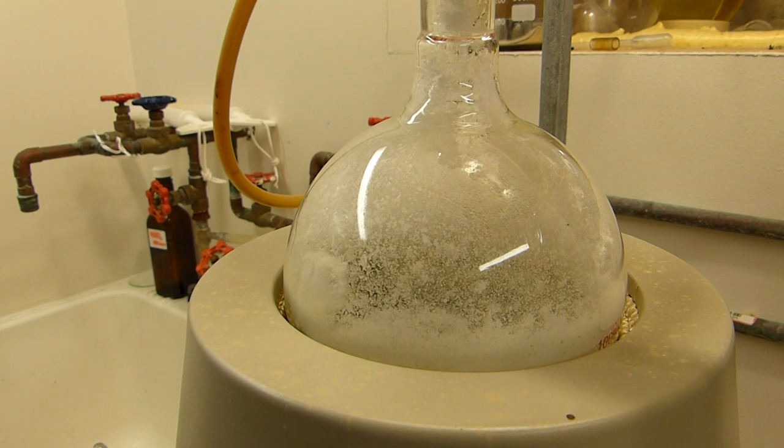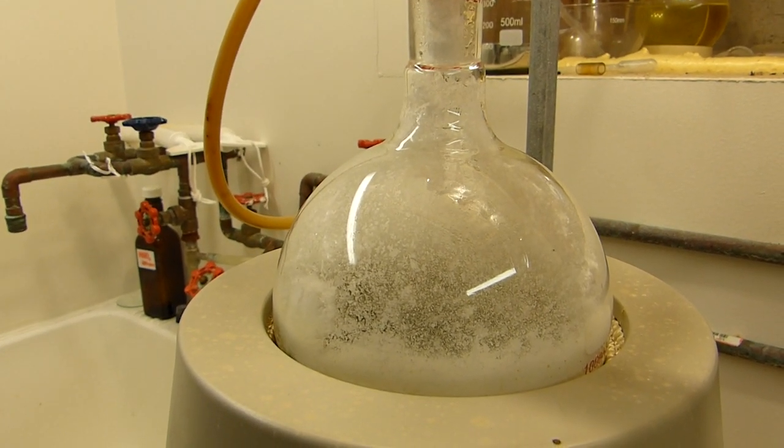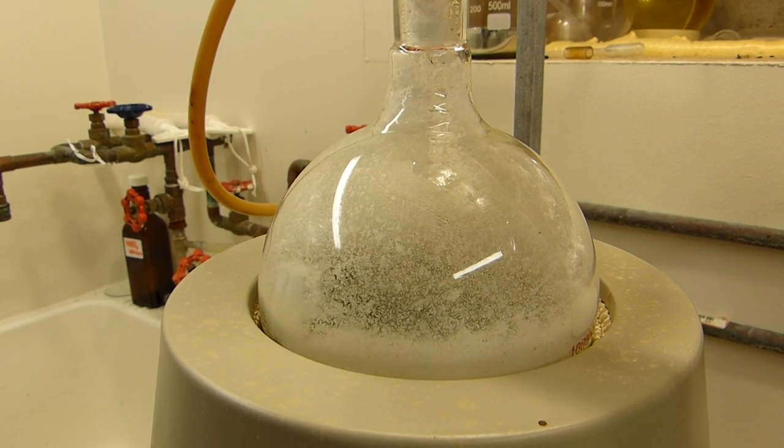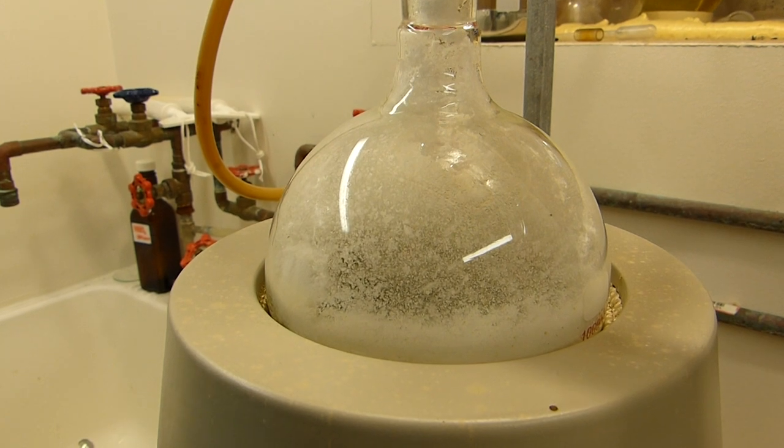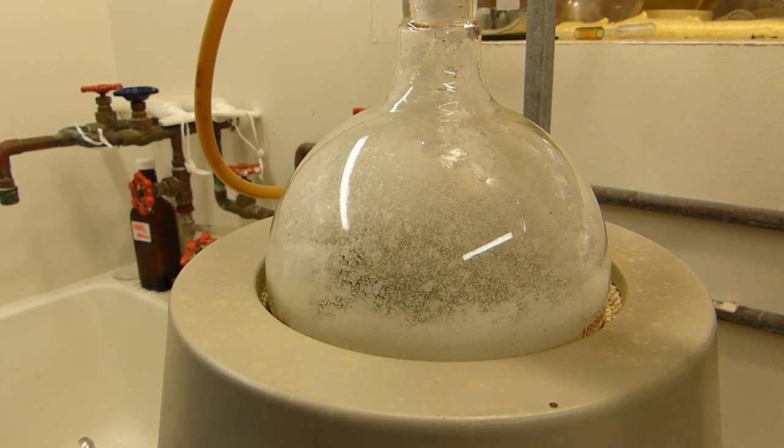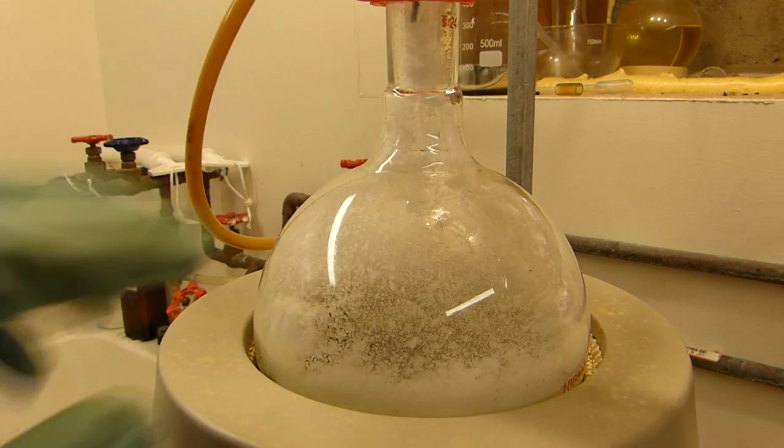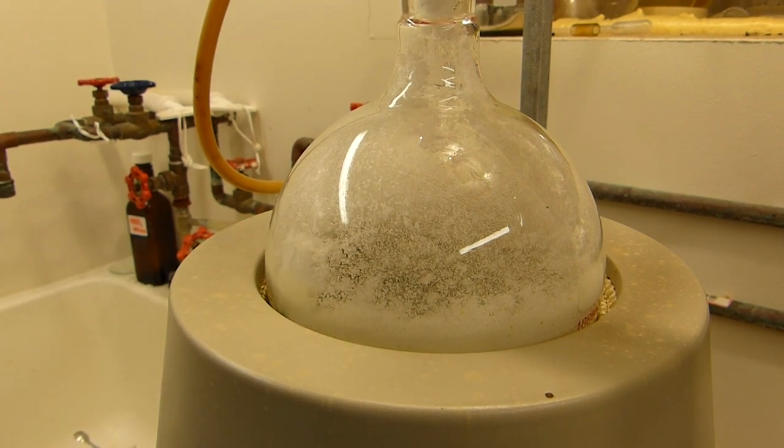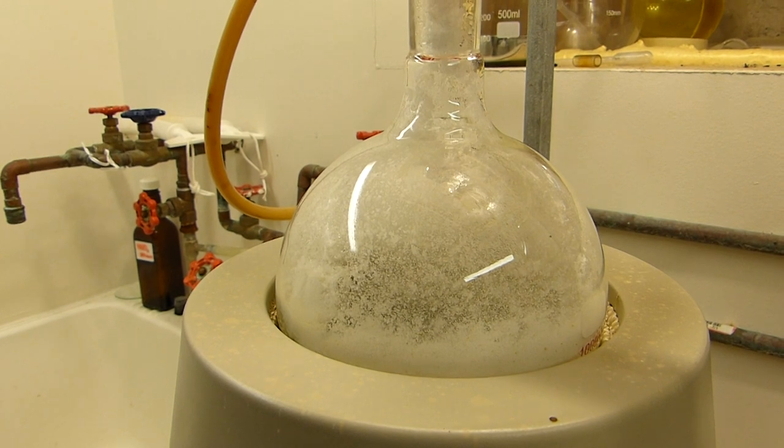So what's happening here is there's an equilibrium that needs to be established between the still head temp and the flask temp. Here we need to reject as much nicotinic acid as possible while passing pyridine, sort of like a fractional distillation, but you can't really use a column because if you did it would just get clogged. So basically the decarboxylation needs to happen at pretty high temperature and at that temperature the niacin has a significant vapor pressure even as a solid or in this case the liquid mixture. So it tends to sublime or boil out and then deposit on the walls of the flask whereupon it falls back in. Now we don't want it to end up in the still head so we need to keep the temperature between the still head and the top of the flask here different enough that we don't get a whole lot of niacin through but we let as much of the pyridine through as possible. We want to return the niacin to continue the decarboxylation. However if we keep this too low of a temperature then the decarboxylation doesn't happen at an appreciable rate and we'll be here all day. So you can see we're pulling pyridine at a decent rate and I think this mantle setting should be good, I'm at like one third according to the power controller over there.